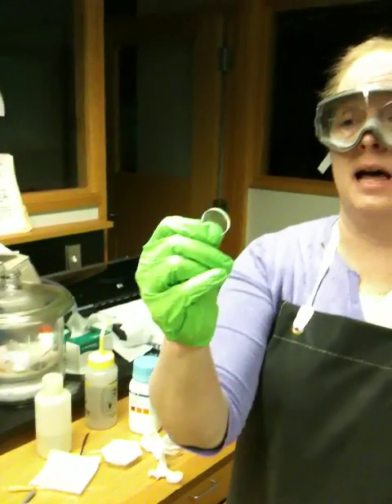The very last thing we need to go over in regard to infrared spectroscopy is how to run a liquid and also how to clean up. This is the cell I ran at the very beginning in the first film, where I made a film on top of it of a solid.